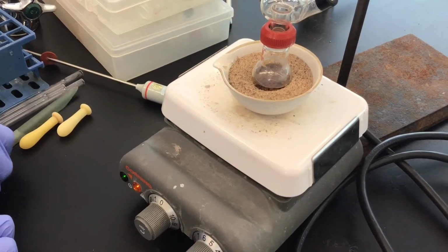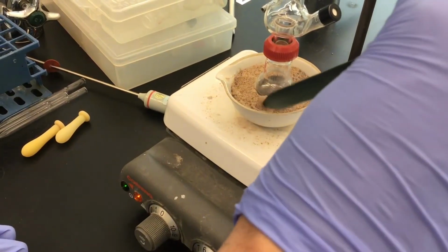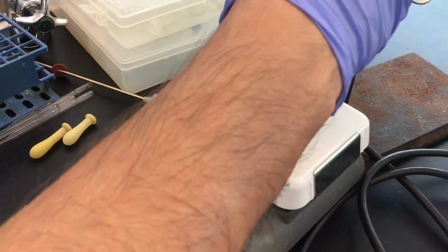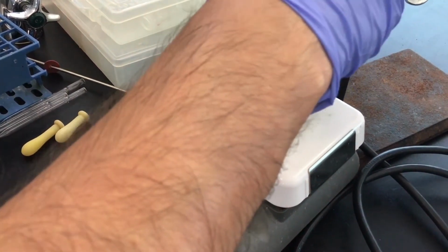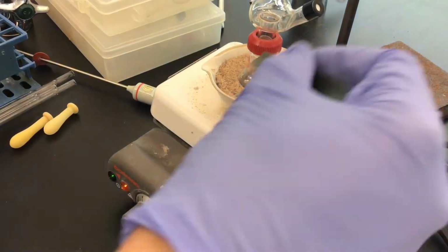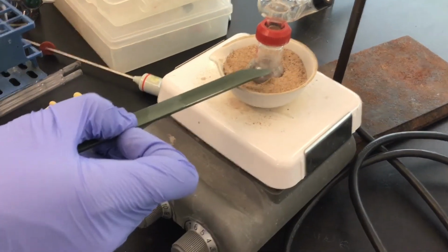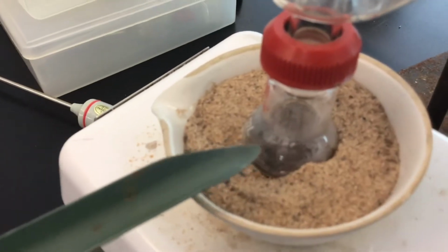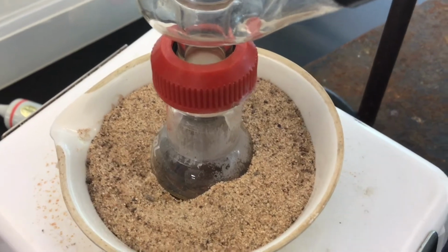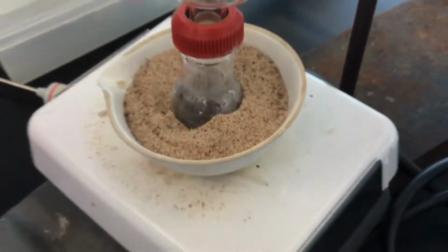If you want to be good about it, you can use a scoopula or your micro spatula to make sure that the sand is touching all the parts of the round bottom flask. You can bury it a little bit more. I don't like to, because I want to be able to see how much volume is down there, because I don't want to actually burn the cinnamon bark. But you can already see that it's starting to steam somewhat, and steam and then collect on the edges here, because we had this sand bath going pretty early, and it's probably going to start boiling pretty quickly.